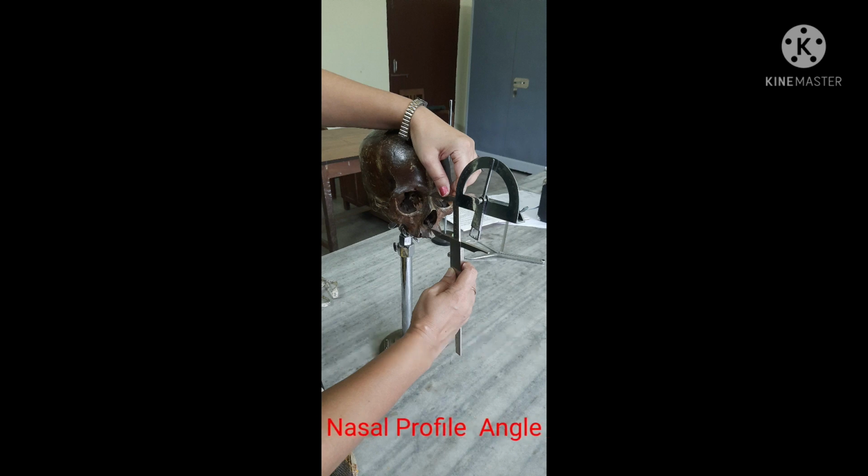Nasal profile angle. This angle is formed by the nasion-nasospinale line over the Frankfurt horizontal plane. It can be easily measured in an oriented skull with the stationary goniometer. The 2 points of the instrument rest on nasion and nasospinale.